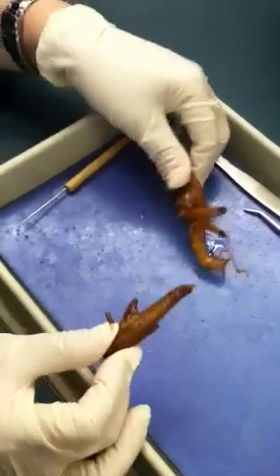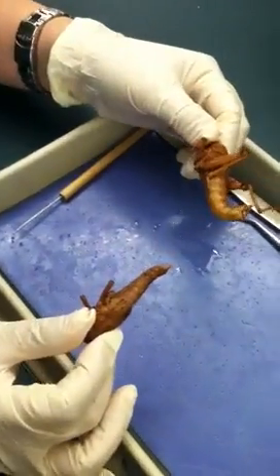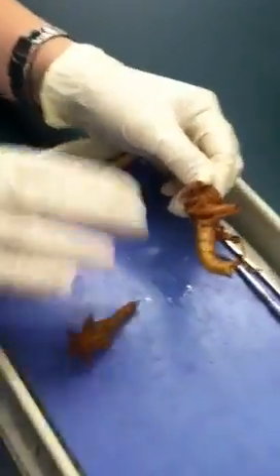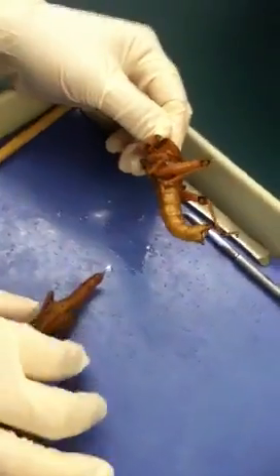Okay, so that's the grasshopper, and we don't actually do a dissection on it, so we just observe the external structure.